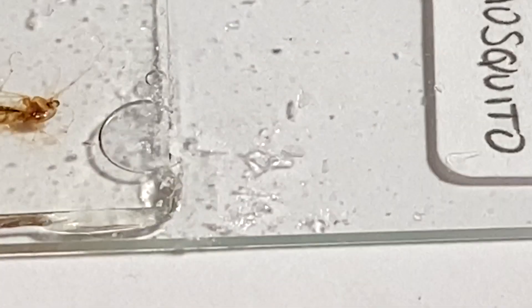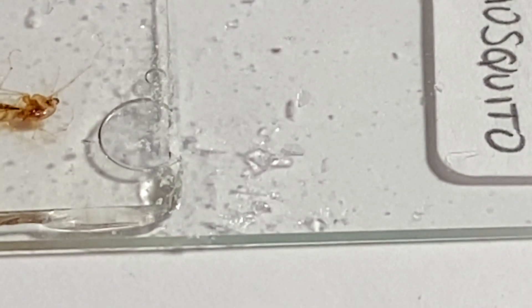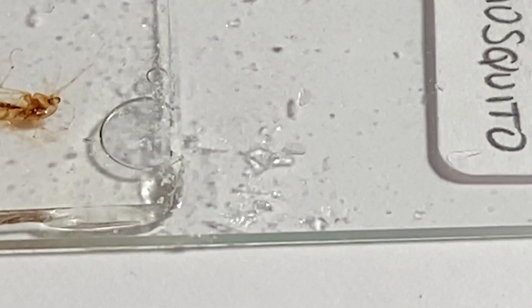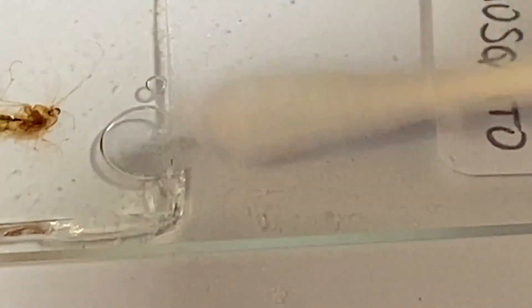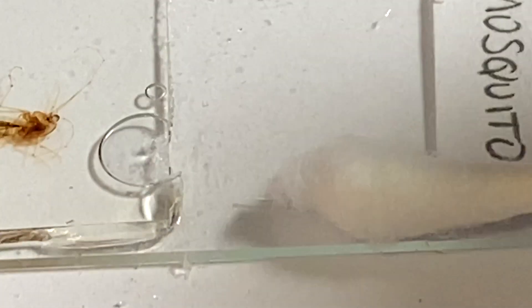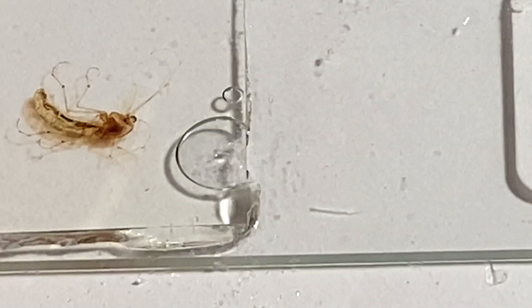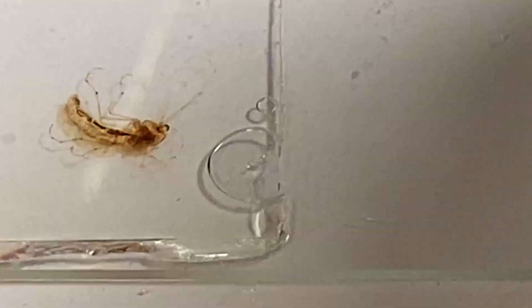But for me, I find bubbles to be unprofessional. When I look at prepared slides and I see that they are beautifully done without bubbles, I'm always asking myself how on earth did they do it? Some people tell you nobody's ever come up with a definitive solution — they've got all kinds of techniques for laying the coverslip down. Sometimes it works, sometimes it doesn't.